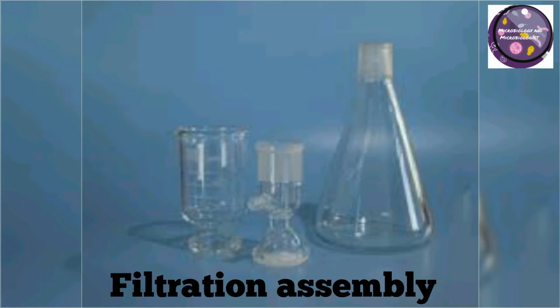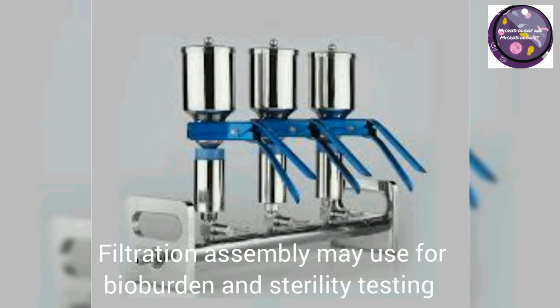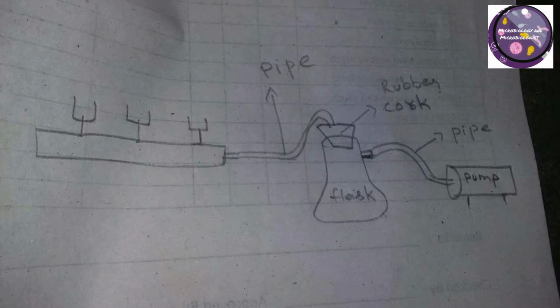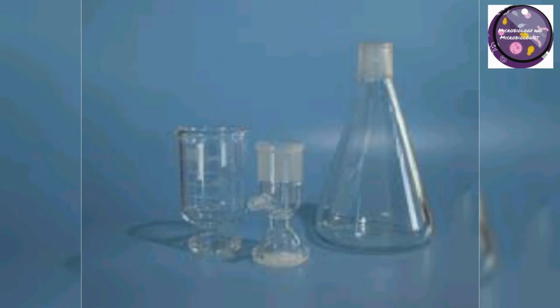Filtration assembly. Filtration assembly is used in some testing methods like bioburden of products and sterility testing of sterile products. There are different assemblies available in the market, like with 1-chamber, 2-chamber etc. We use membrane filtration paper.